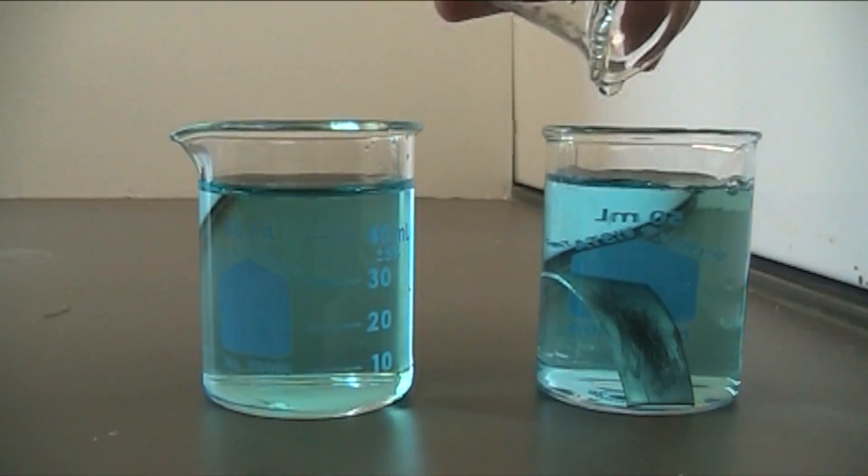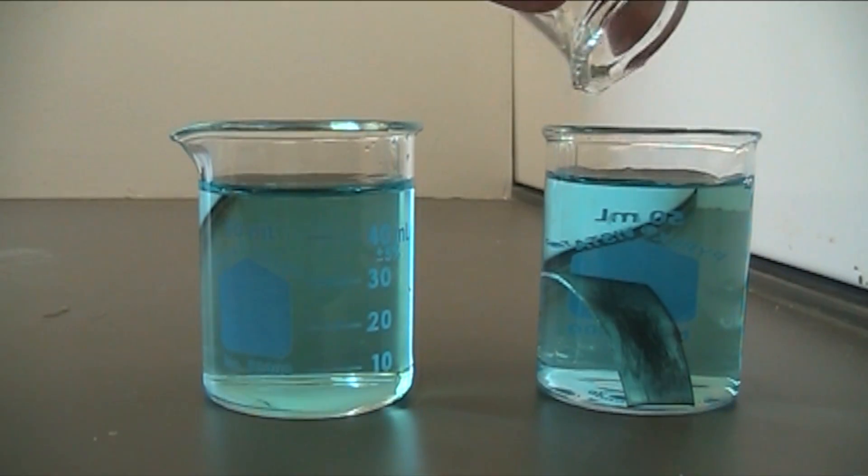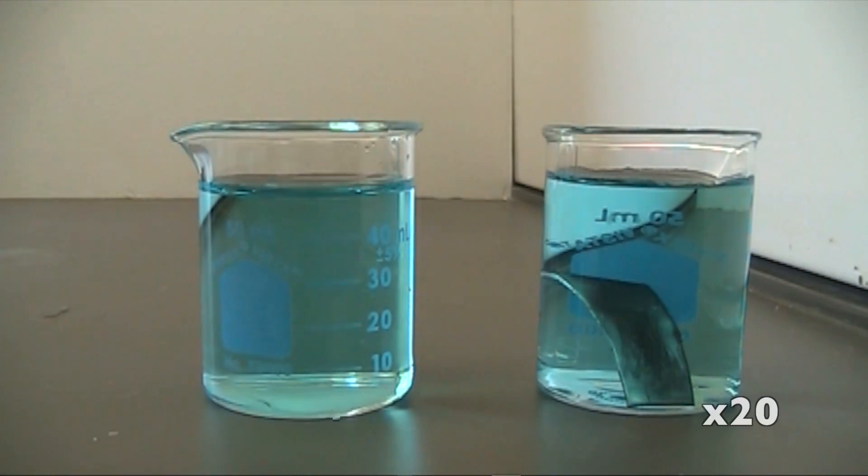One of the greatest joys of inorganic chemistry are the beautiful sights you create for your eyes to feast on daily. Today we shall be investigating the reaction between zinc and copper sulfate.